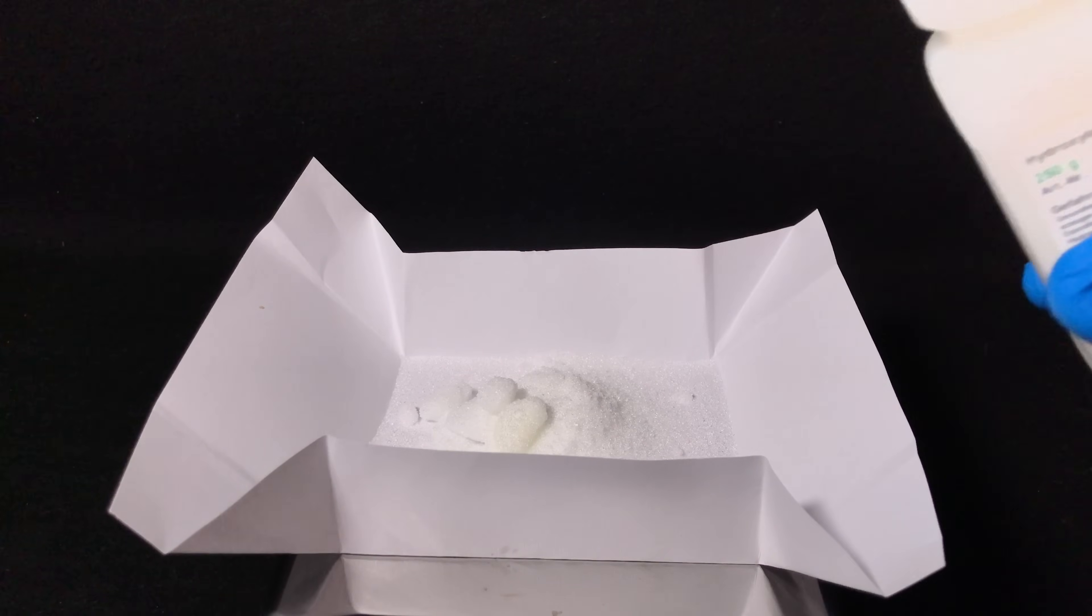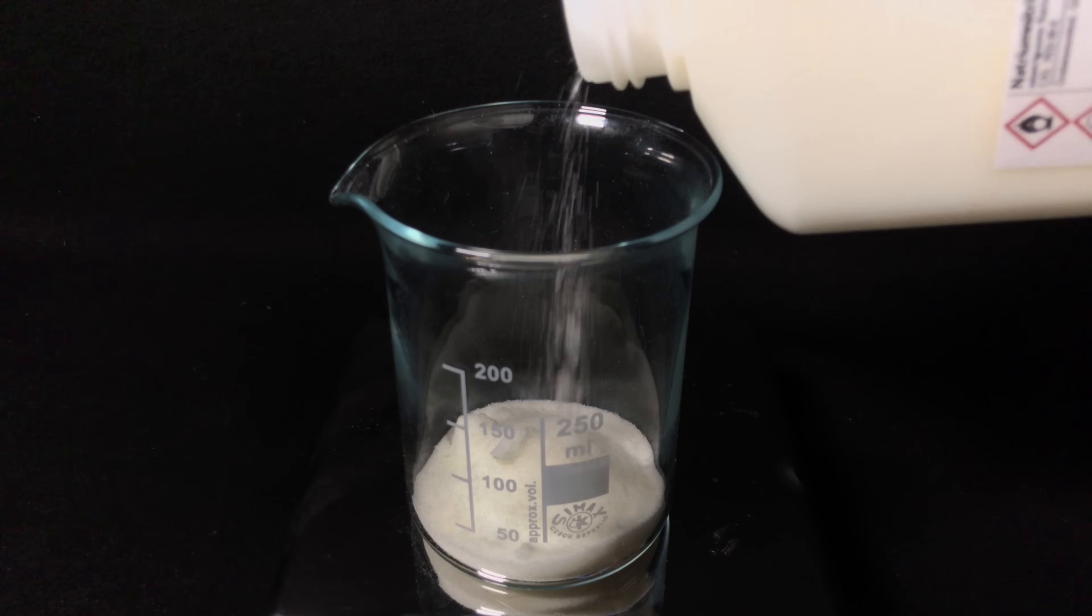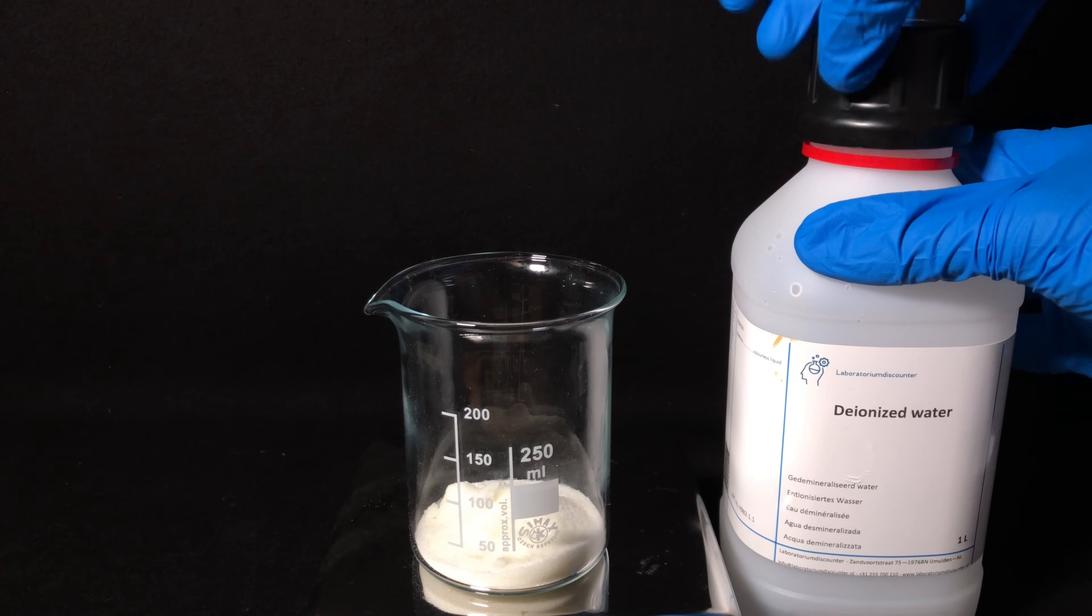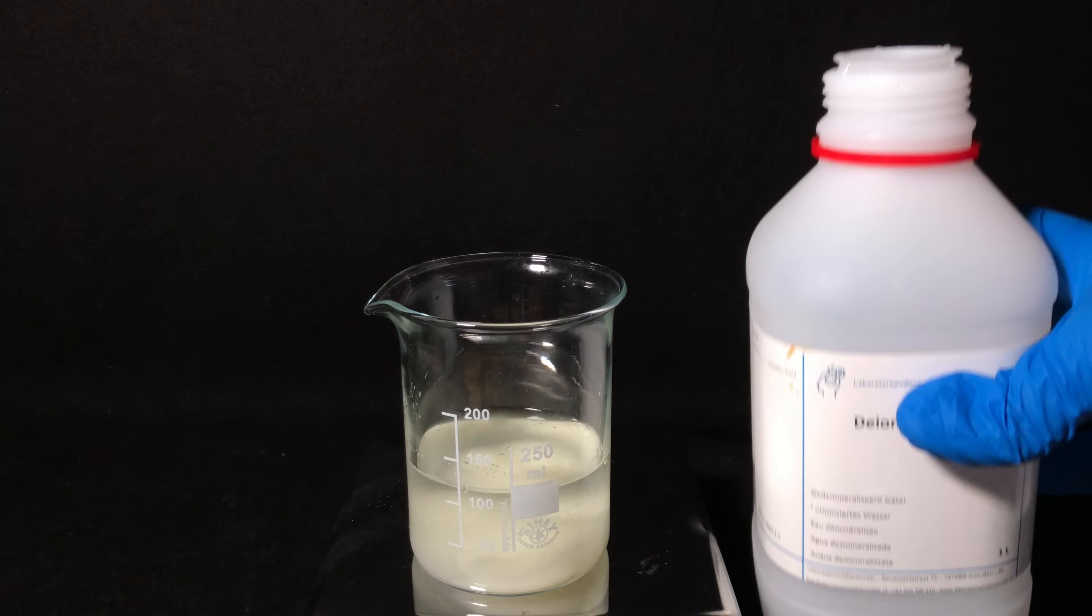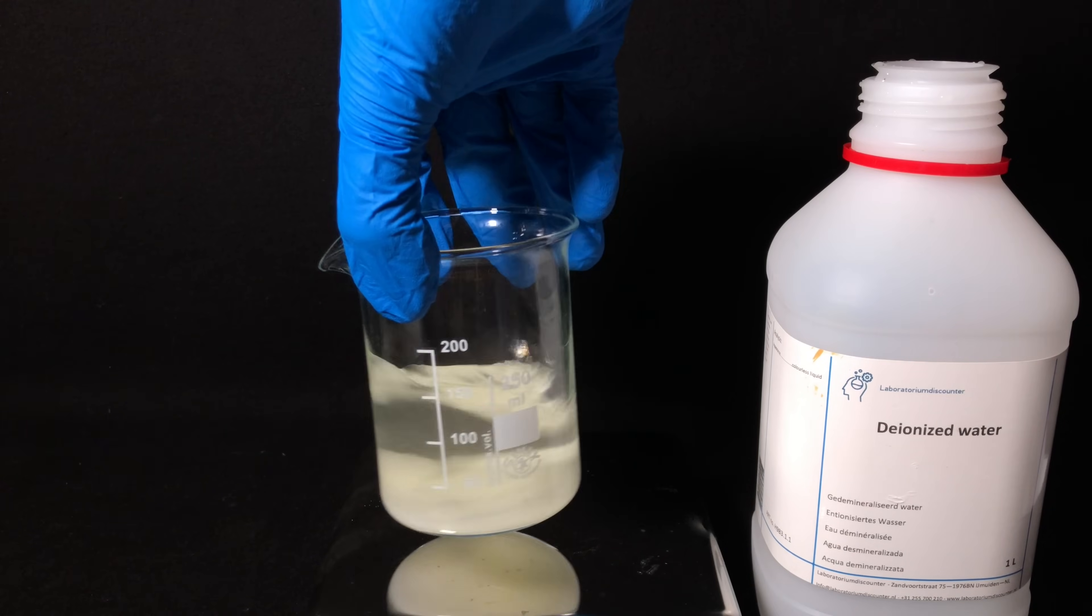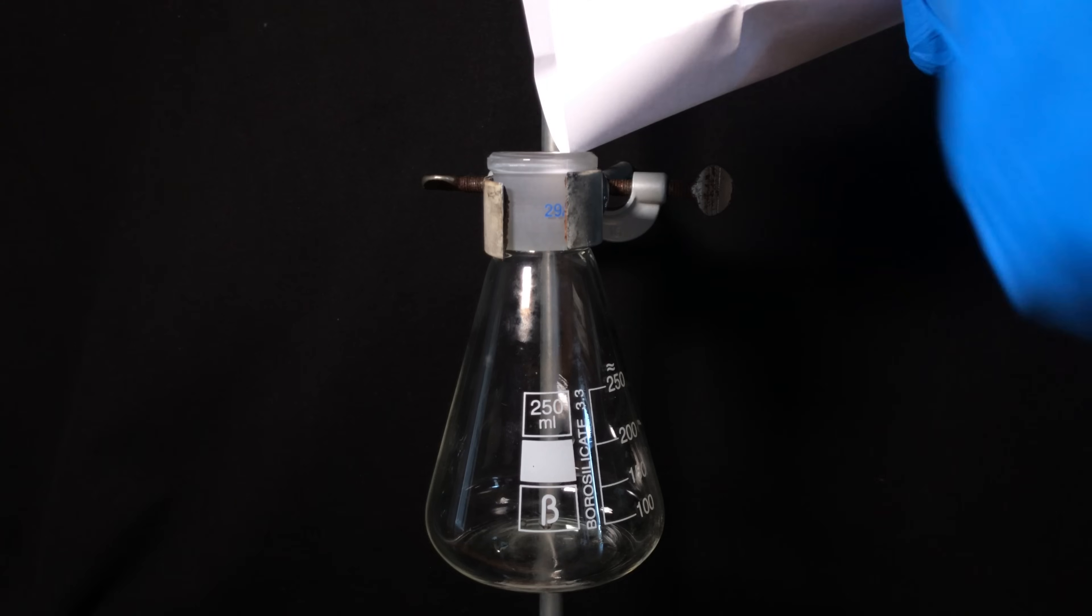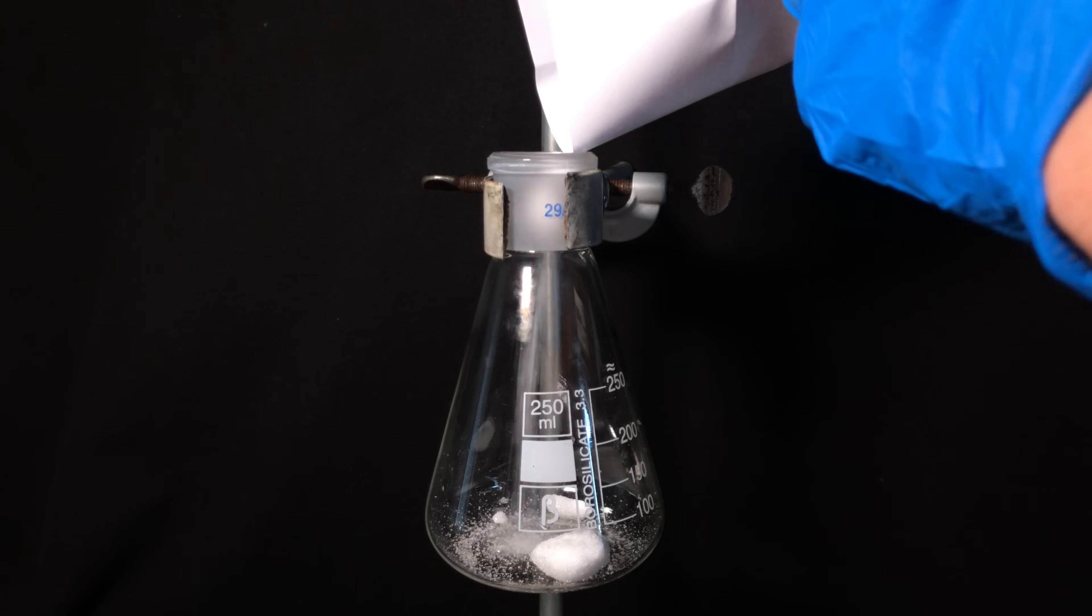We started off by weighing out the hydroxylamine hydrochloride and sodium nitrite in separate beakers, and everything was dissolved in distilled water separately. Don't just add everything to a beaker and add water because you are going to get laughing gas without actually being able to use it for something useful.